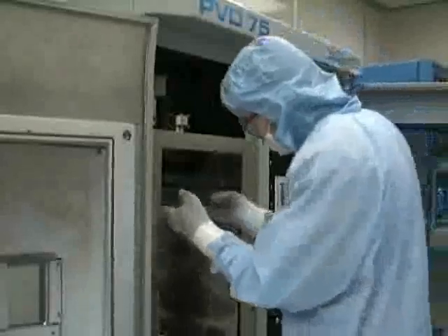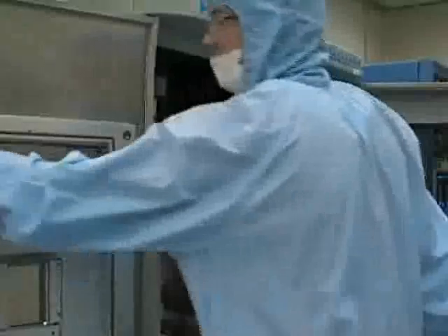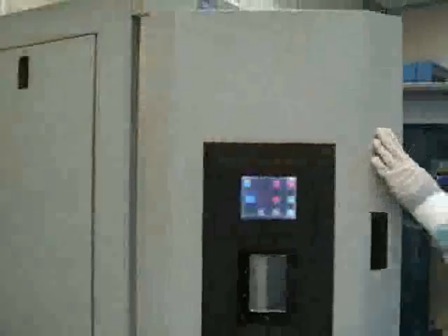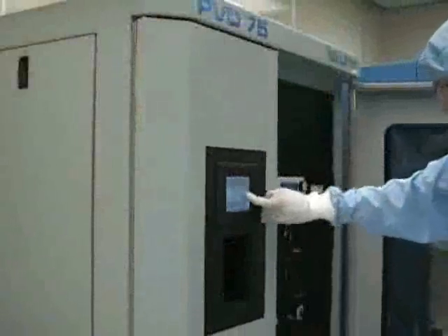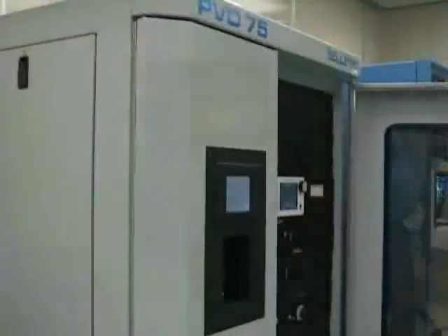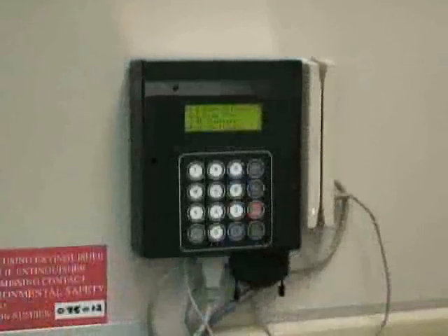Once your sample has been removed, you should close the chamber door and begin pumping the chamber down. Press the Pump Down button on the front panel touchscreen to initiate the pump down sequence. Make sure that you don't leave the machine at atmospheric pressure. Once the PVD is pumped down completely, you may log out of the system at the access controller.